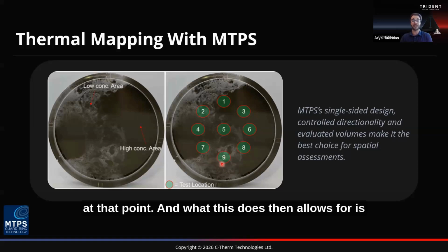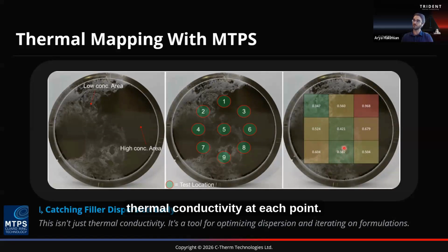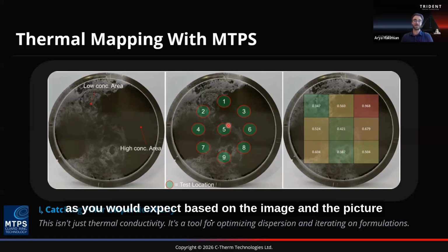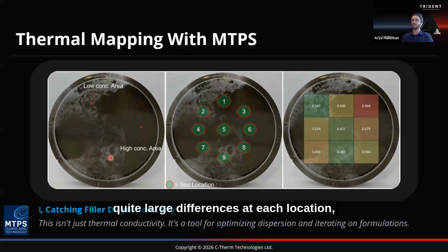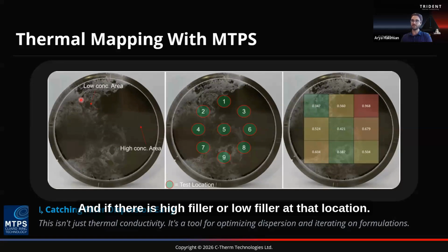And what this then allows for is quite simply a map, or a thermal map, of the effective thermal conductivity at each point. And as we can see in this example here, as you would expect based on the image and the picture here, quite large differences at each location. But we can tie that again to the specific area and if there is high filler or low filler at that location.